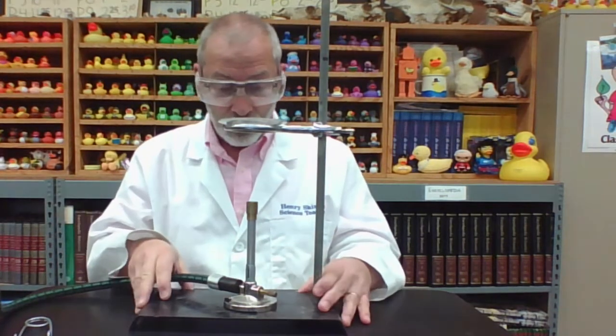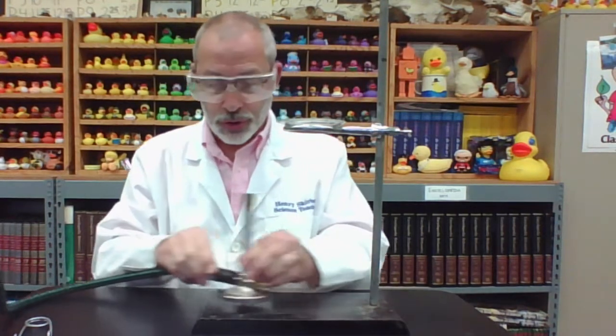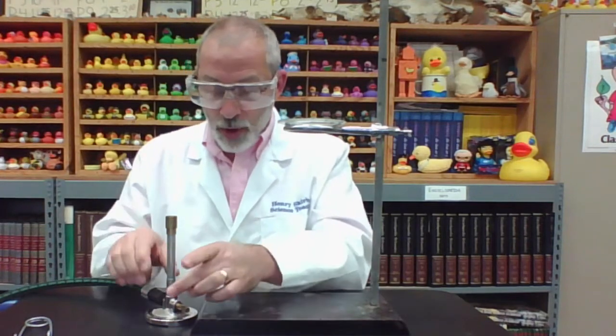And now we're going to begin lighting the burner. I'm going to be lighting the Bunsen burner. If you are doing this yourself, I encourage you to review the video on lighting the Bunsen burner. Remember the proper steps of lighting the burner so that we can do this safely. I am working solo here, but normally you would have a safety person at the jet and a burner person at the burner. The way we should operate the burner is to light it off of the ring stand. Once we have it with a good flame, it is safe to pick up your burner by the base and the tube and then place it under our evaporating dish to make our additional observations.